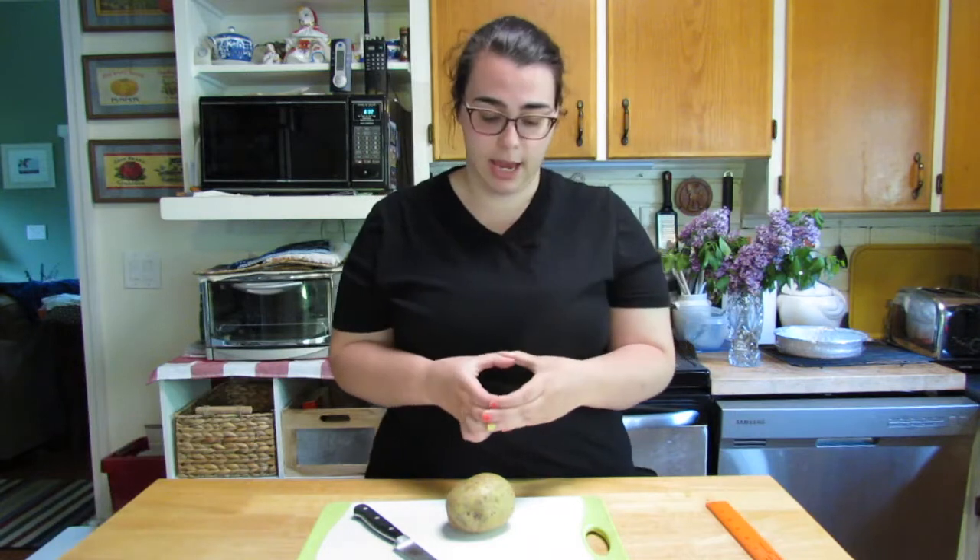For today's lab we're going to do a little bit of at-home microbiology. Have you ever walked into my classroom and noticed that it can smell really bad? Sometimes why my room smells so bad is because I am growing bacteria. One of the best labs that we do during the microbiology unit is growing bacteria samples — taking petri plates, swabbing and taking samples from various spots around the school, and growing them to see what the bacteria looks like.